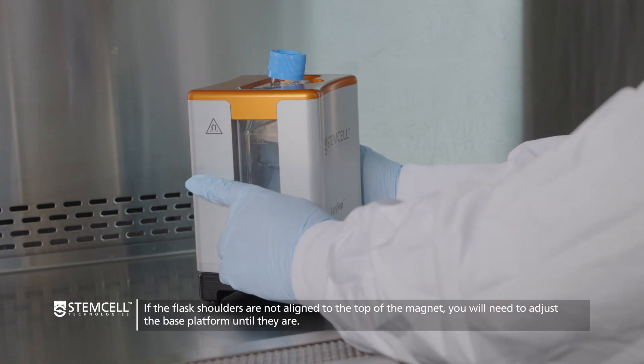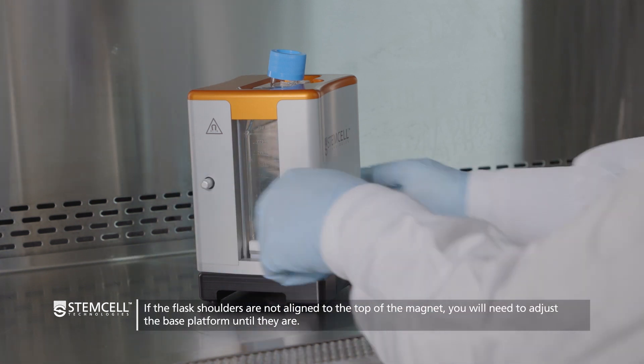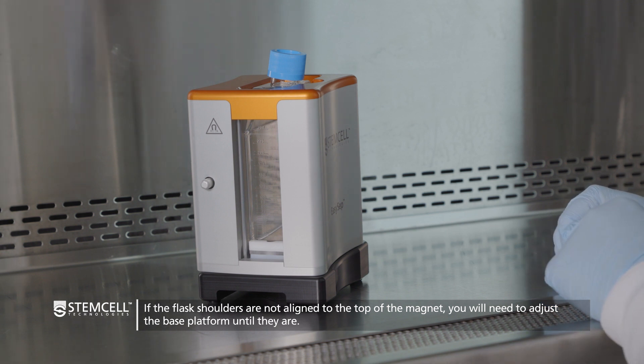If the flask shoulders are not aligned to the top of the magnet, you will need to adjust the base platform until they are.